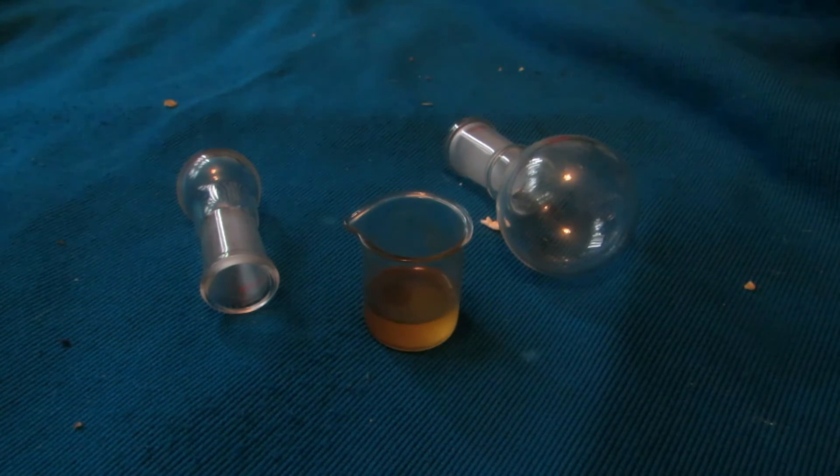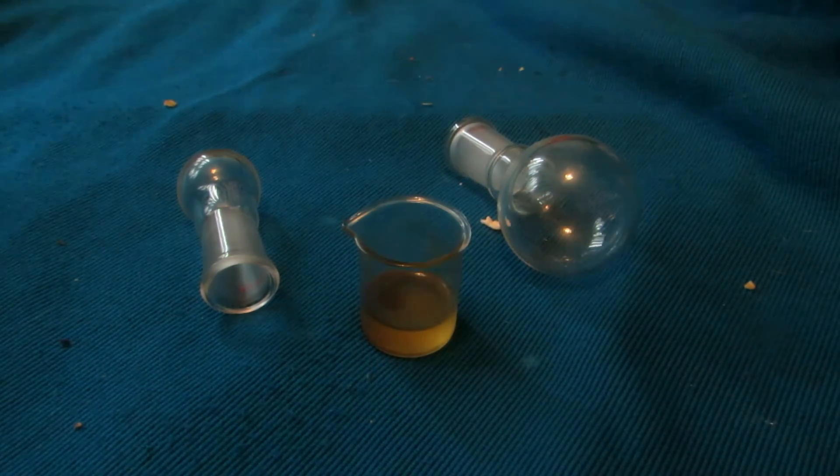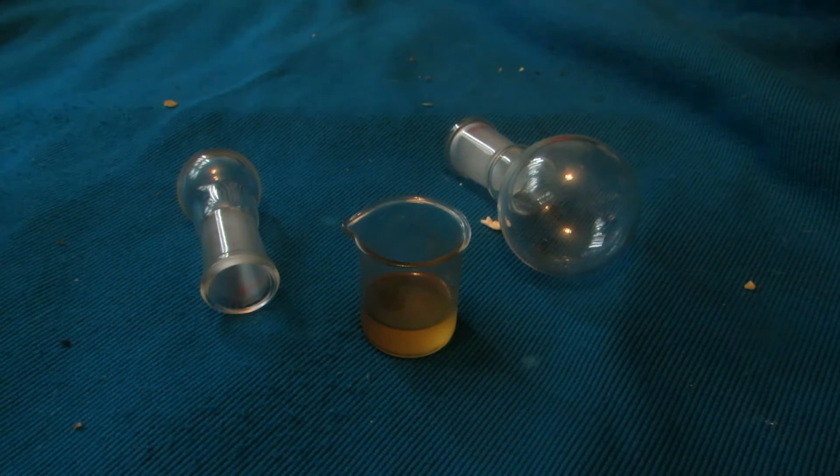The lower methyl salicylate layer was drained off, and you can see it's still pretty crude but smells really nice. It has that characteristic minty smell of methyl salicylate.